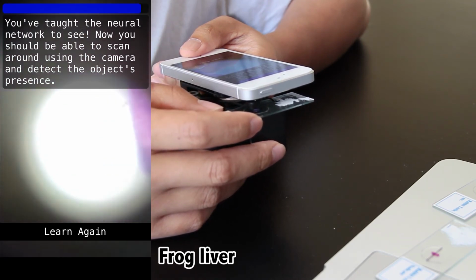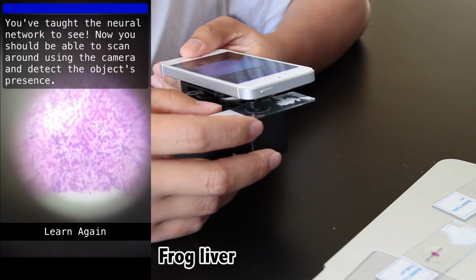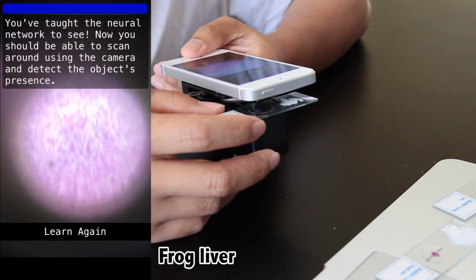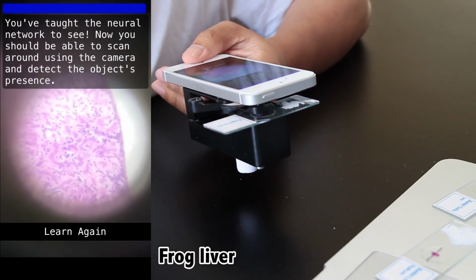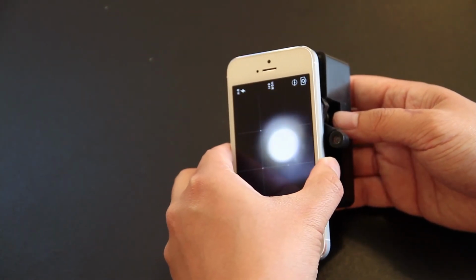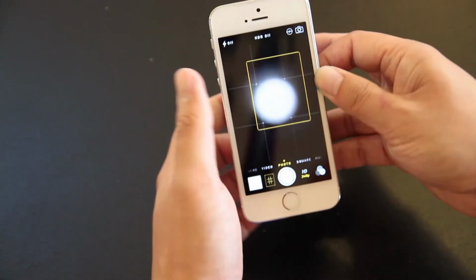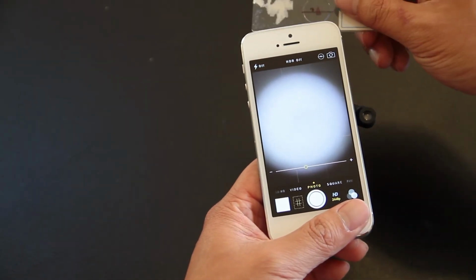In fact, the SDK for this algorithm is available from the Jetpac company on an open BSD license. Although they do make it clear that it wasn't particularly designed around identifying liver tissue. Maybe you'll be the one who'll improve on this software and technology. Eventually, there will be the software that combines a digital microscope with an internet-connected computer to really become the world's first smart microscope, or as some may call it, the Tricorder. And this is one of the first baby steps in that direction.